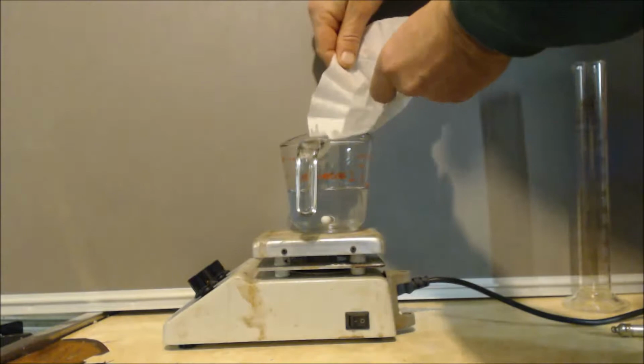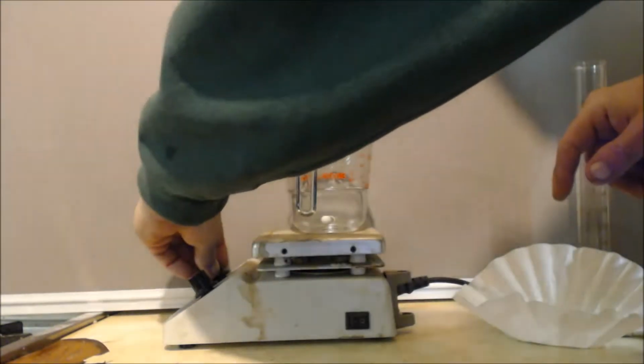I know that the copper sulfate anhydrous is like 160 grams or something like that a mole. So I figured 1/5 of that, or 1/5 of 150 would be easier to figure out, which would be 30 grams. So I think I put like 32 grams in there, something like that. That was my reasoning behind that weight: if it's a pentahydrate, that means it can absorb 5 moles of water. If I divide by 5, then it can absorb 1 mole of water, right? Mostly anhydrous. I'll start this up so it spins.